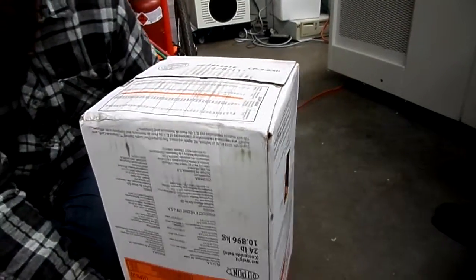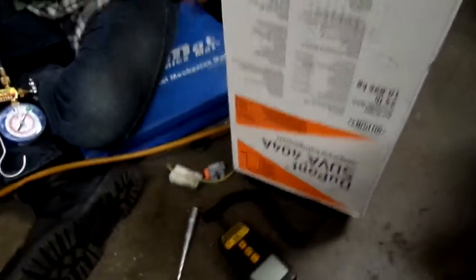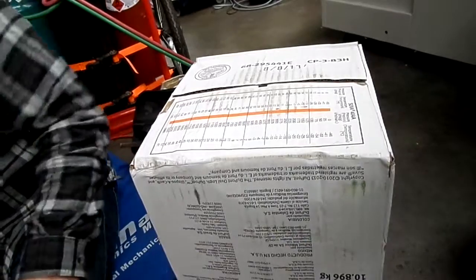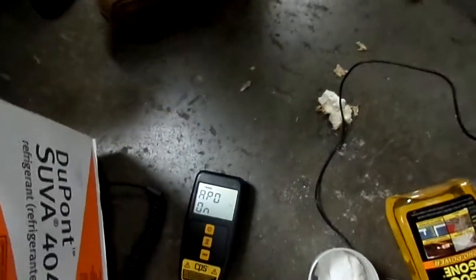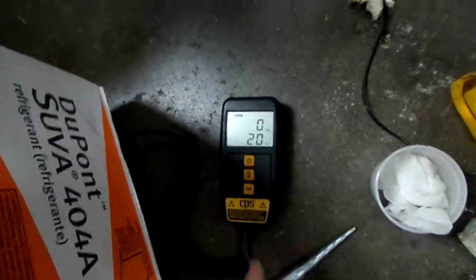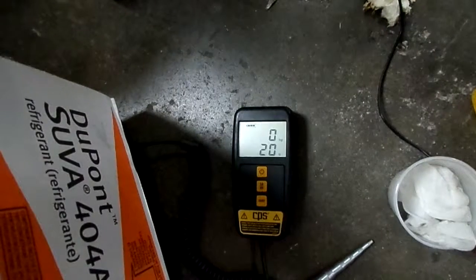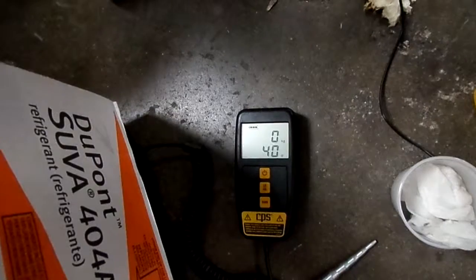Let me turn it upside down. This is a full tank. And then you'll see it's wiggling. The tank's rocking back and forth. You want to wait for that to settle, because it'll give you a bad readout on your scale. So you'll see it's bouncing around like 50, 60. And that's because it's rocking. So we have to wait for that to settle down. Once that's settled down, then we can fill it up.